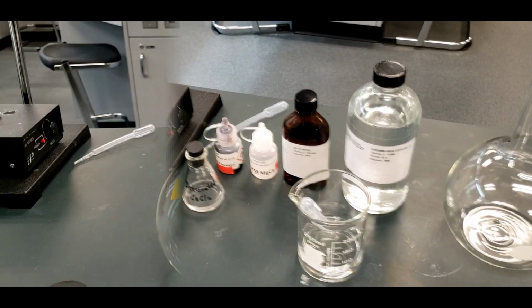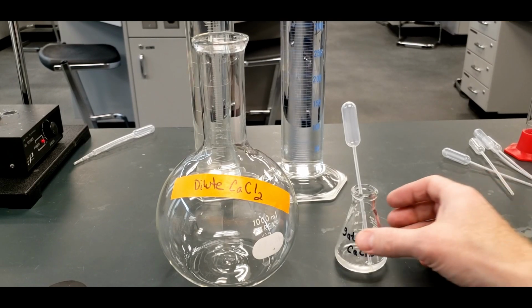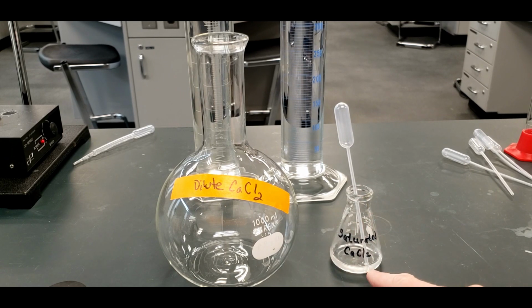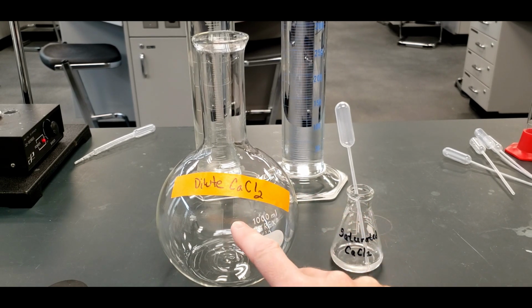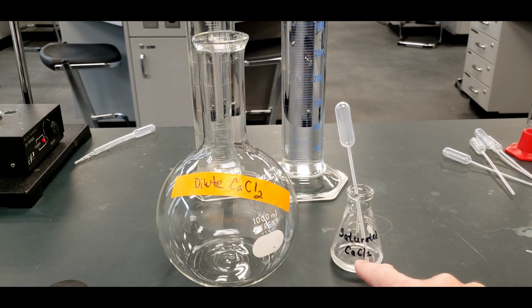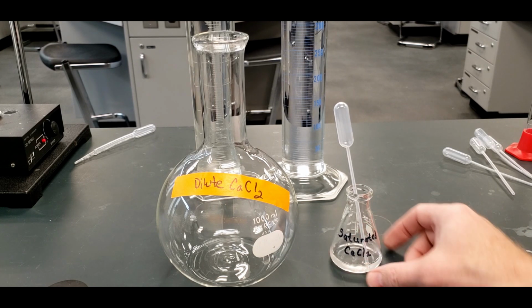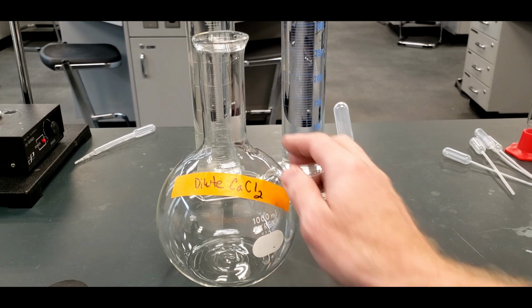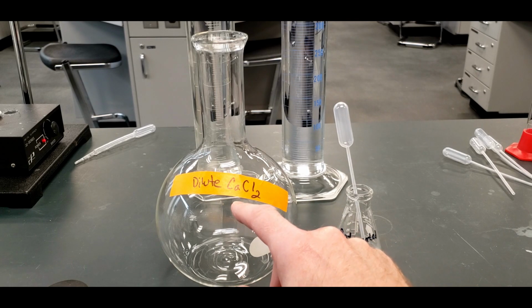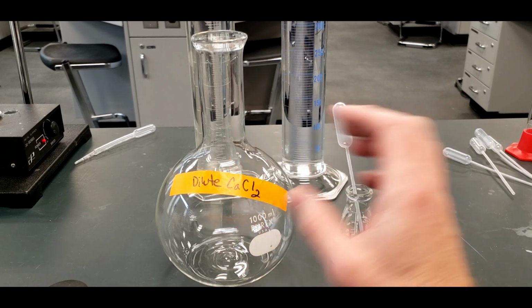Let's get started. So we're going to make our dilute solution of calcium chloride, and we have the saturated one, and we're going to be titrating this with EDTA to determine how much calcium is in here so that we can determine how much is in here. And you might wonder why we don't just titrate this, but EDTA is used to determine really low concentrations of calcium. We could definitely try titrating this, but we'd need gallon upon gallon of EDTA solution. Here we won't need as much, and then we can backtrack. We just have to keep track of how much we've diluted it.